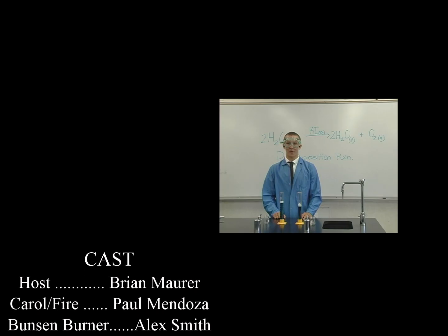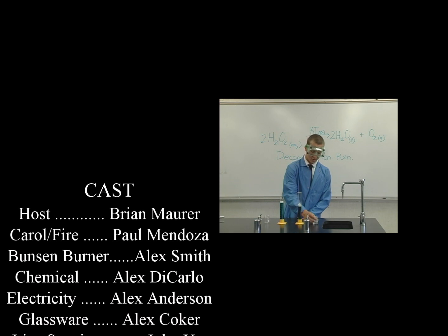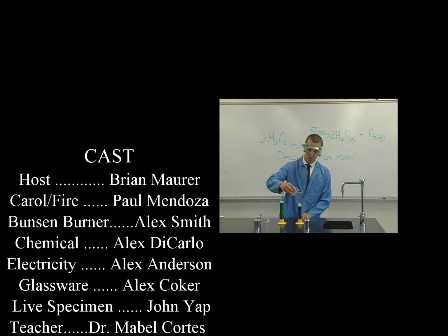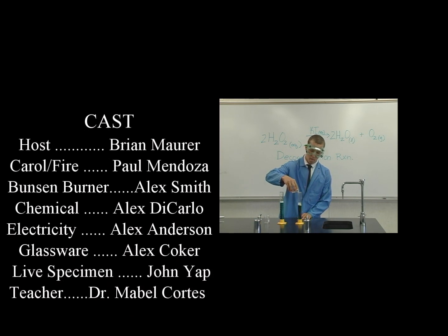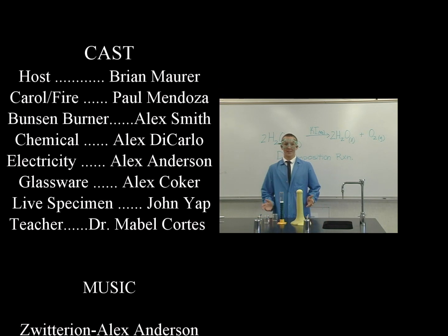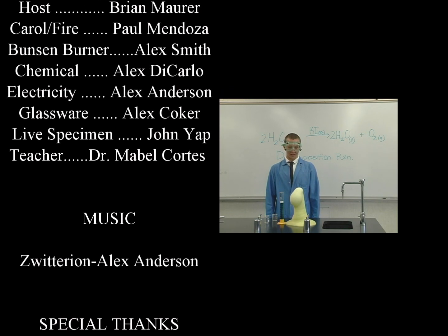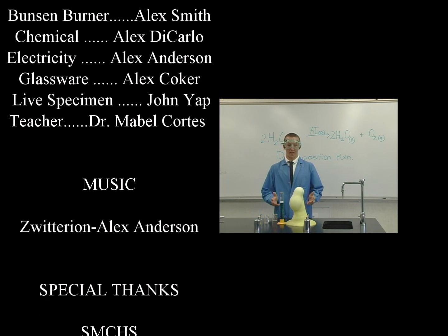The second reaction will be a lab that follows all procedures and does as instructed. As you can see, when you follow the instructions and obey the procedures, the labs end up to be a lot more fun.